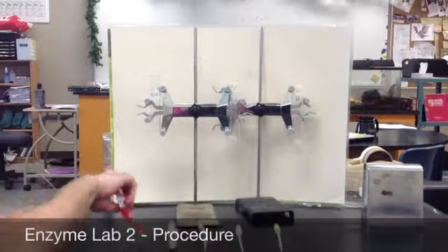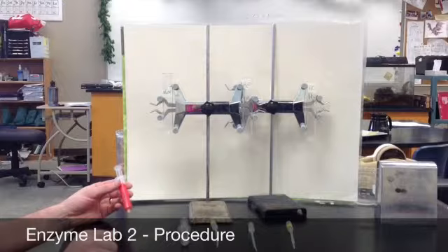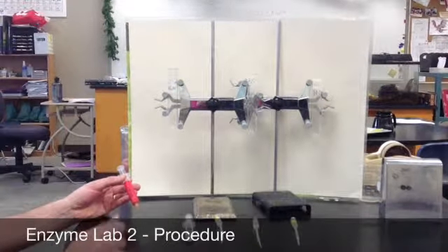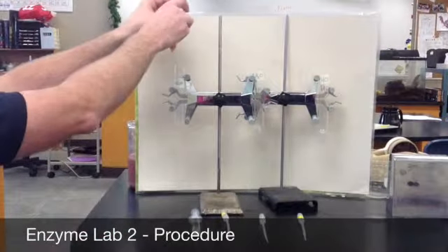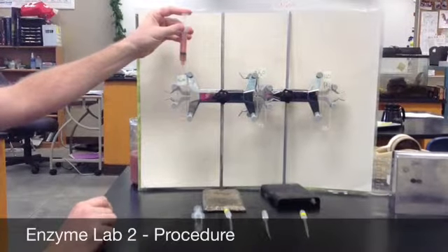So we are going to carry out part 2, the effects of pH on enzymes. To do that, we're going to start off by adding a milliliter of catalase solution, which is a liver homogenate, to each of these test tubes. So we'll add 1 milliliter of that to each test tube.